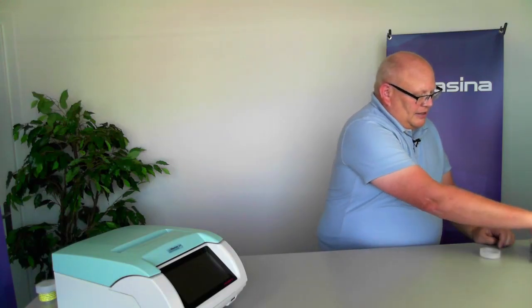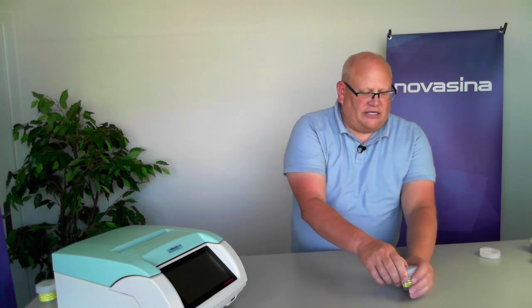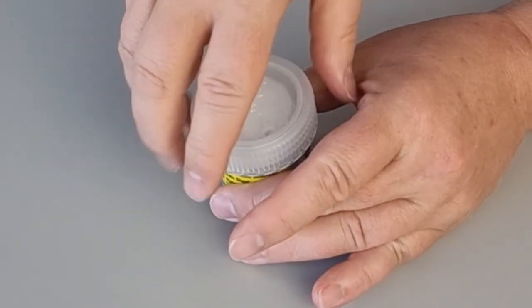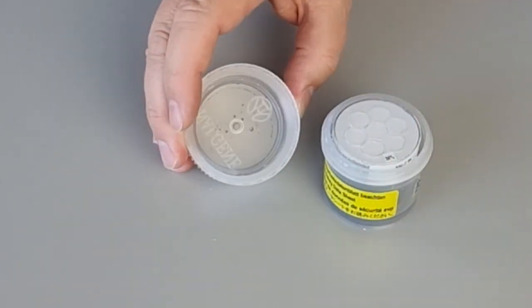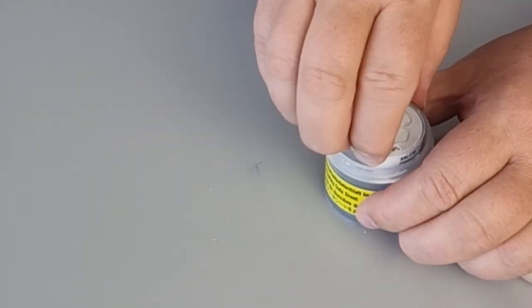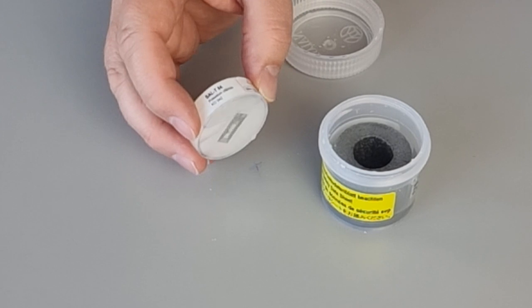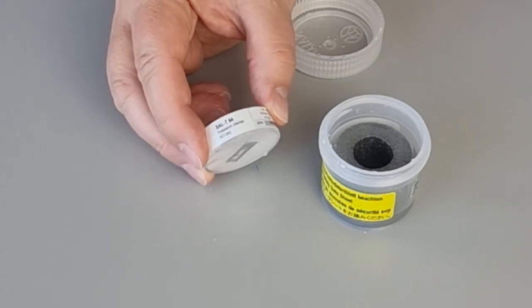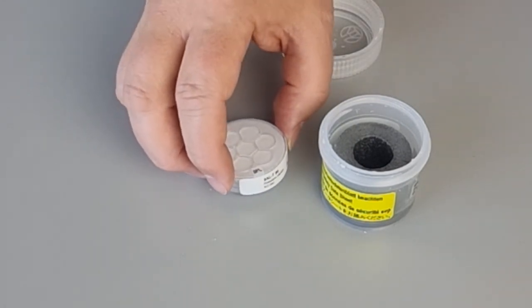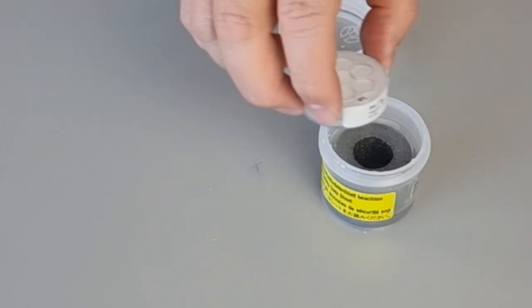And then the last possible problem that we can see with these standards is if they are not handled properly, especially if you have something sharp around them, you could possibly puncture the top part of that standard and it will actually start to leak. So in this standard, you can see there's actually liquid on the top of the cup that's come from the standard leaking out, and the standard is covered in salt crystals as liquid has leaked out of the standard and gotten all over the cup. In that case, that standard has been ruined and can't be used again and would have to be replaced.